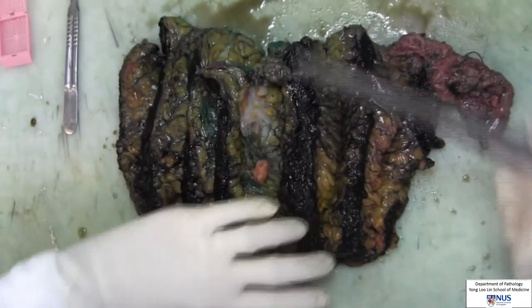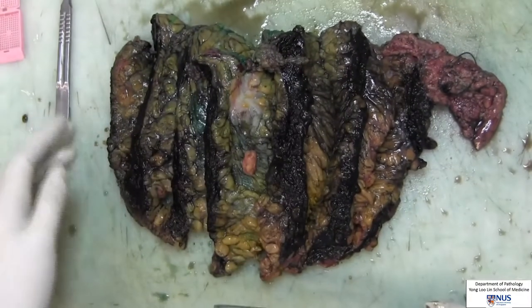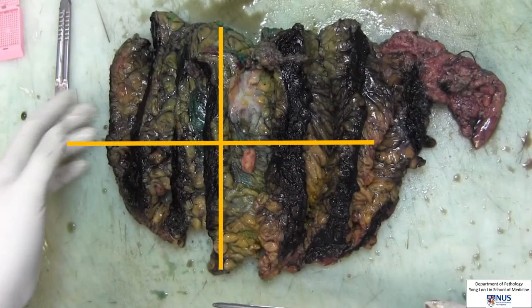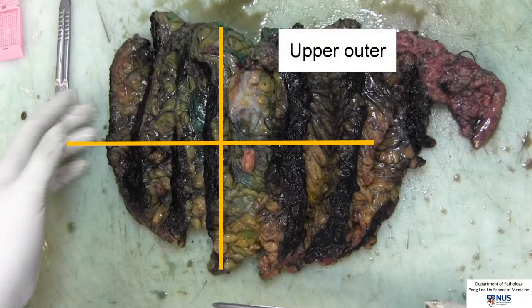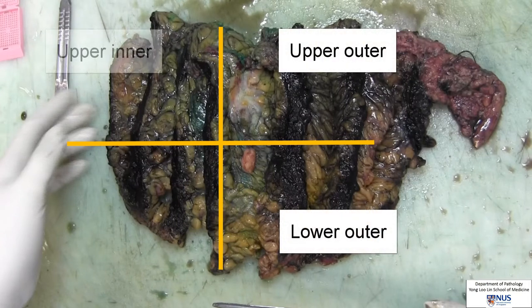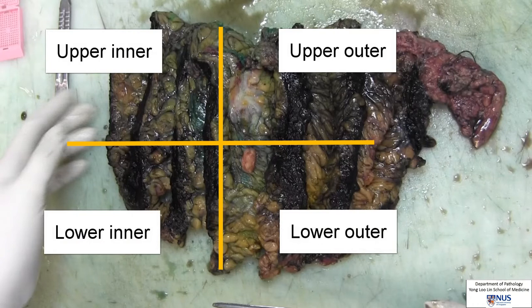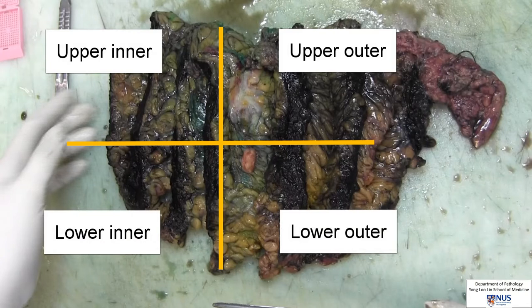The inferior margin is inked yellow. The breast can also be divided into quadrants, namely the upper outer quadrant, lower outer, upper inner, and lower inner quadrants. The tumour in this case is located in the upper outer quadrant.